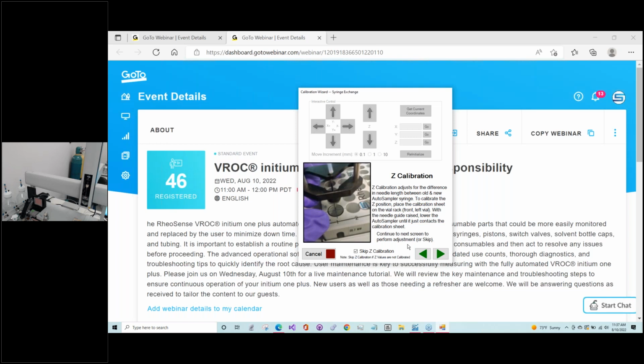The calibration of the auto sampler, including the Z, is generally only necessary if you've had to take off the whole auto sampler to move the instrument or to have some kind of repair. So generally, just swapping out the syringe or the piston won't require any recalibration of the auto sampler, so we can just go ahead and finish this off.